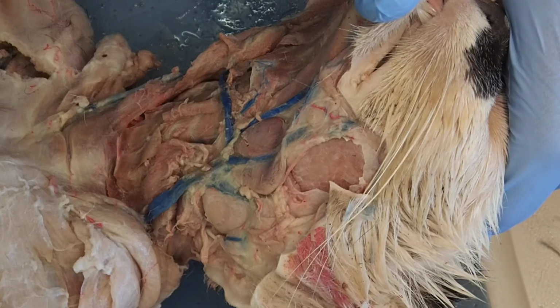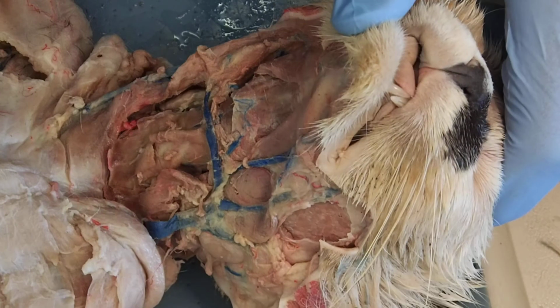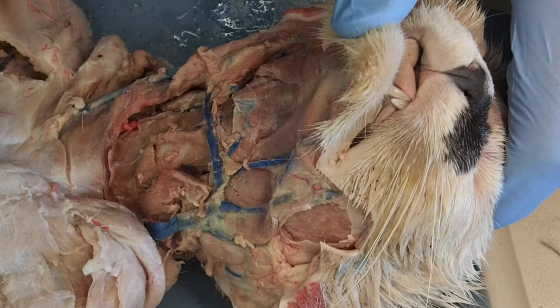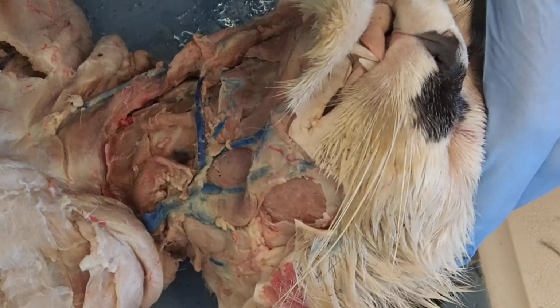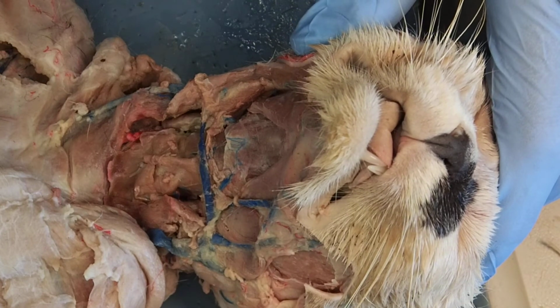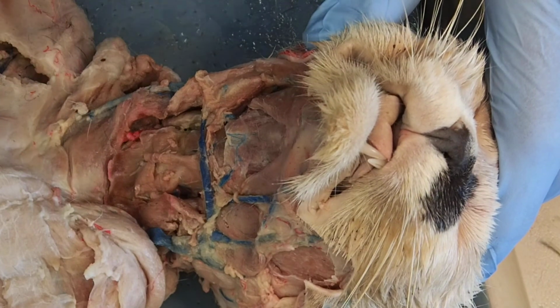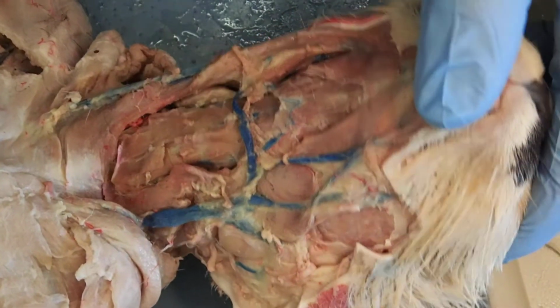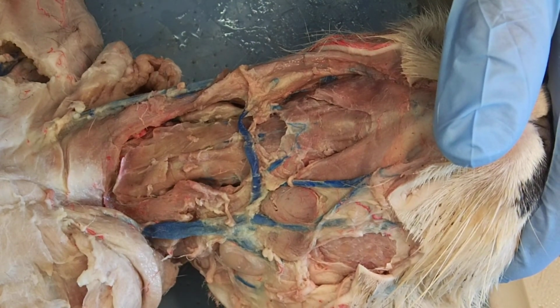There's another muscle called lingualis proprius. Lingualis proprius. It's hard to say these things with a mask on. Lingualis proprius is another muscle that you're looking at right now, and I'm going to let you look it up. Try to figure out which one of these is lingualis proprius. All right, that'll do it for this, and then we'll dive into these deeper muscles in just a little bit.